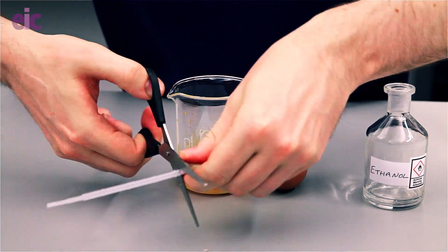Repeat the filling process as before. I'm using a cut pipette to help me load the egg. Once in front of the class I tend to get a few seconds before the egg backfires, but when running around after cameras and lights I found it tends to be a little bit more keen to go. If you do try these demonstrations please do let us know in the comments below — we'd love to know what teachers have made of them. Thanks for listening and I'll see you again in September.